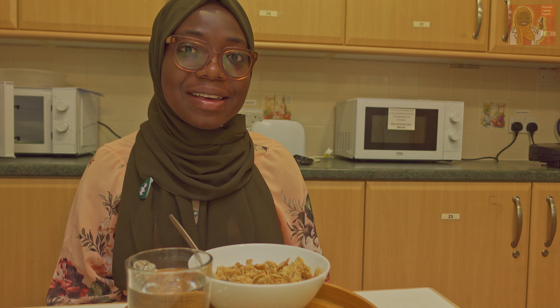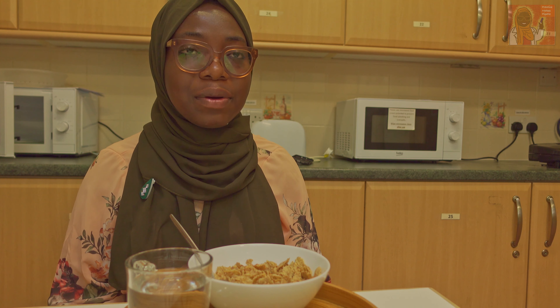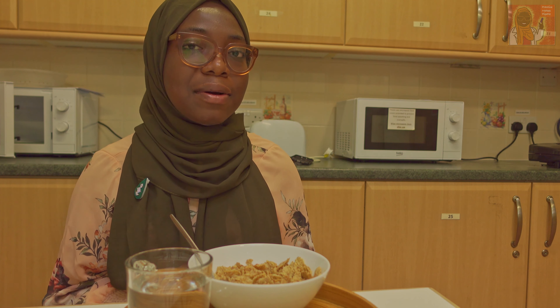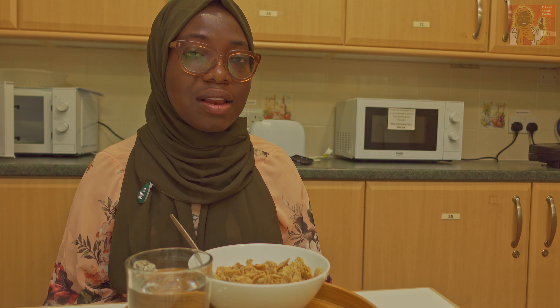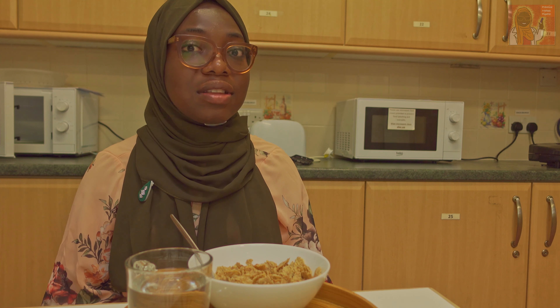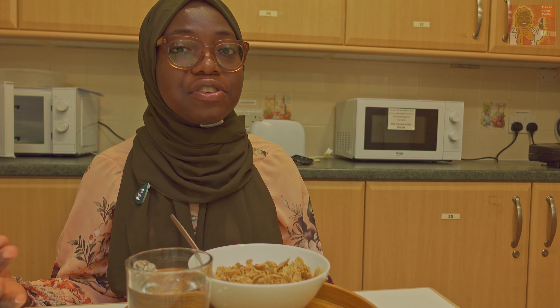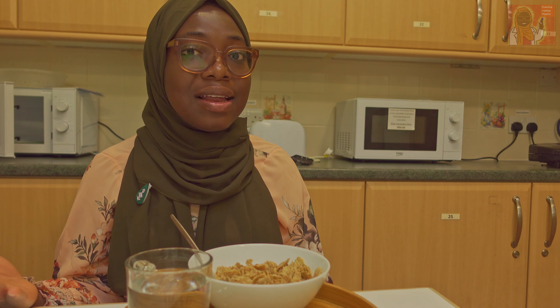Since the end of last week I've been waking up around 6 a.m. because my experiment takes six hours to finish. It takes me around an hour and a half to get ready, then 30 minutes to cycle to the lab, so by 8:30 I would be at the lab ready to start my experiment. If I start at 8:30 I'll finish around 2 or 3 p.m.